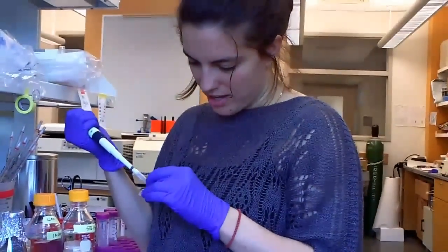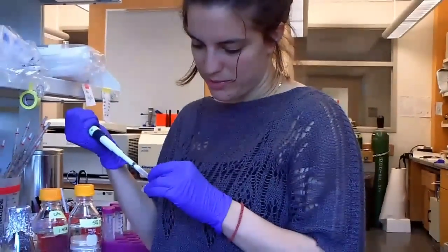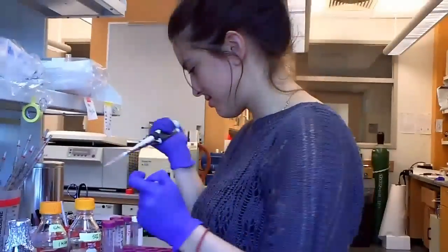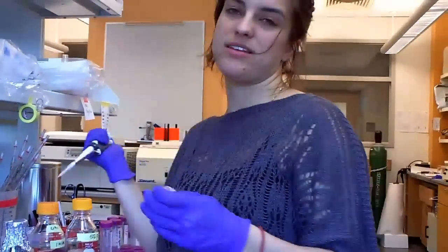Okay, so all I'm going to do is resuspend the cells and then incubate them at 40 degrees for 40 minutes.